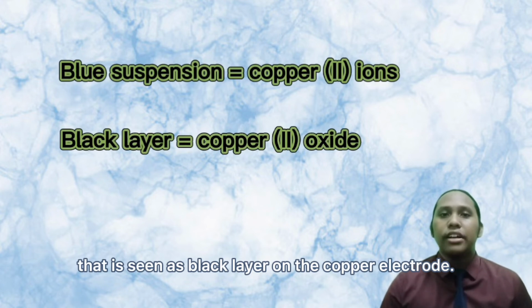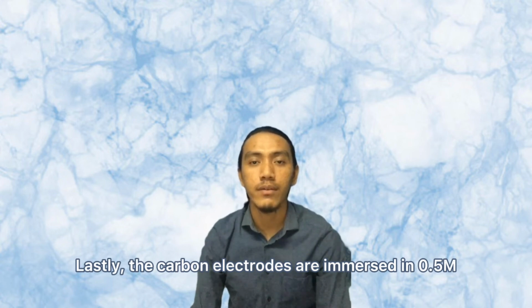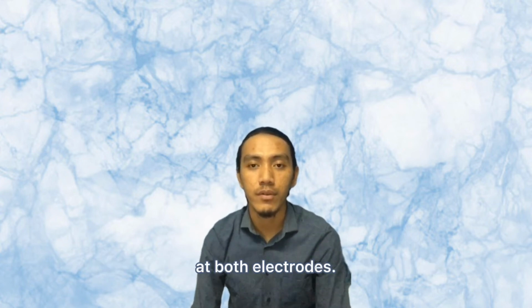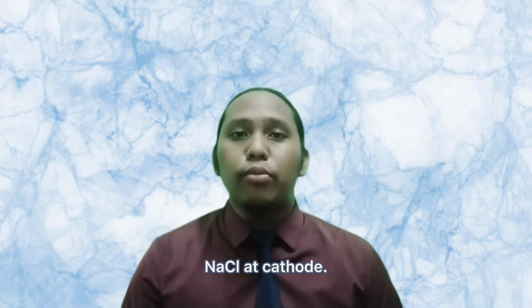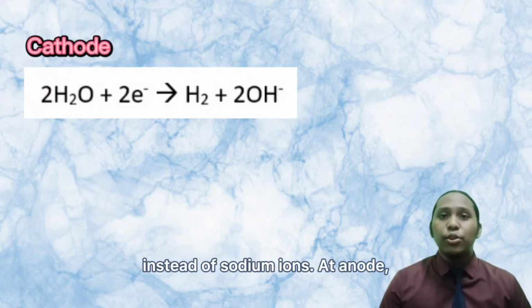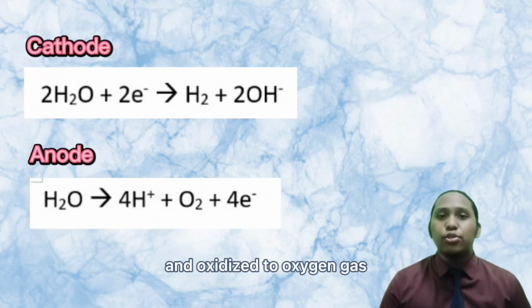Lastly, the carbon electrodes were immersed in 0.5 molar of sodium sulfate to show that a small amount of bubbles form at both electrodes. Sodium ions and water migrate to the cathode. The same thing happens as in 0.001 molar sodium chloride at the cathode. Water is discharged and reduced to hydrogen gas instead of sodium ion. At the anode, water is also discharged and oxidized to oxygen gas instead of sulfate ions.